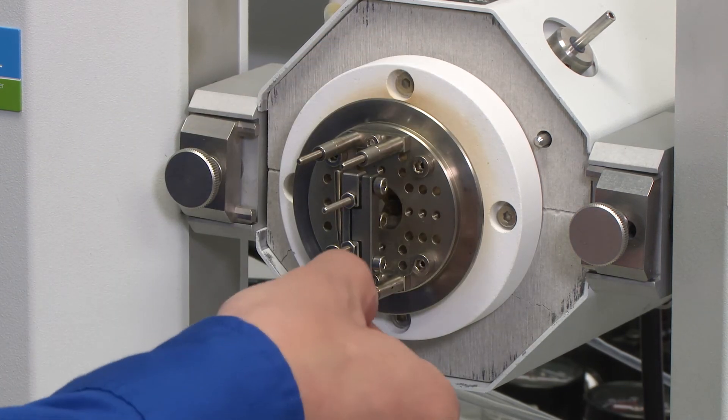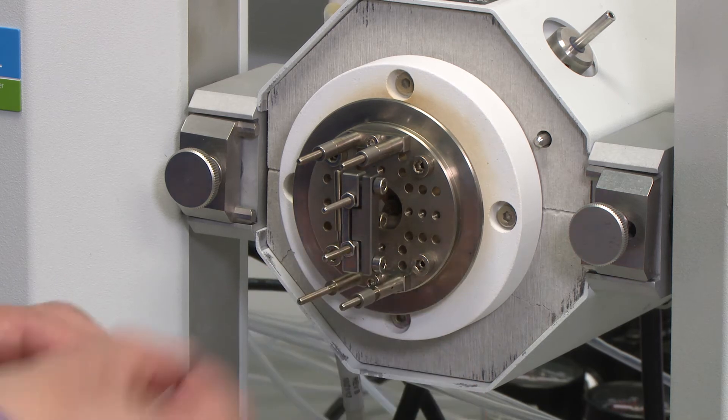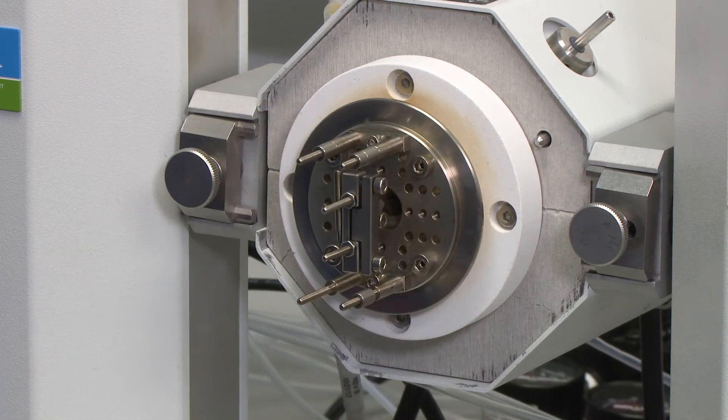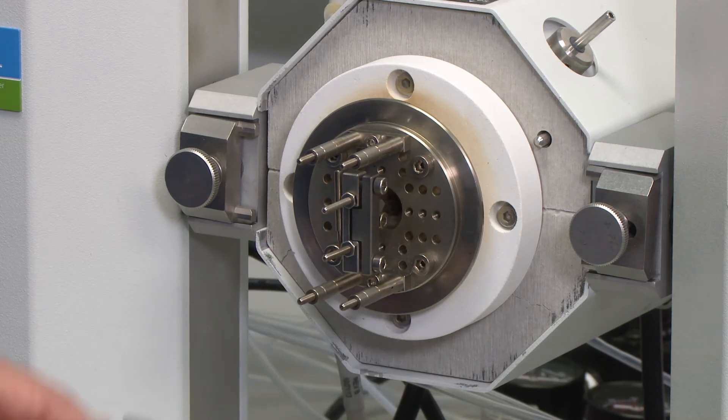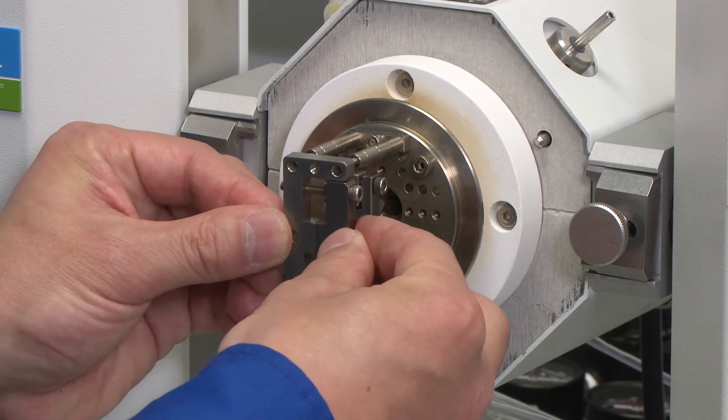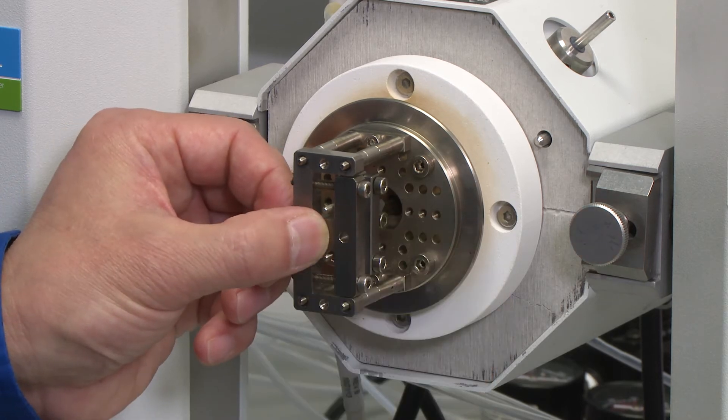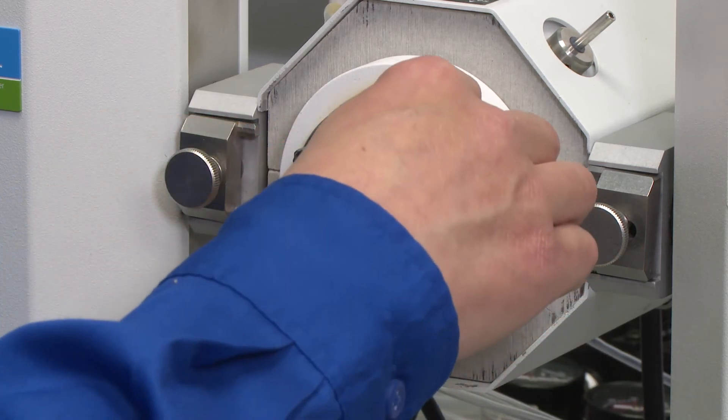For example, right now we have a longer sample, so I'm putting on both spacers on each pillar and the outer clamp on, secured with the hex nuts.